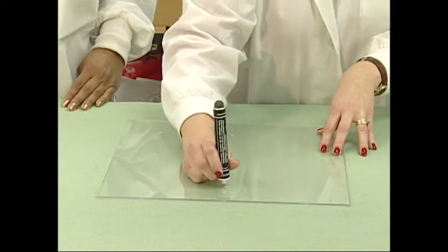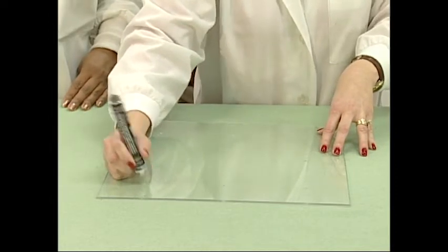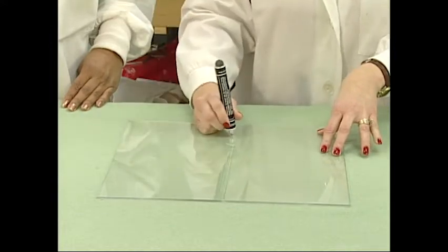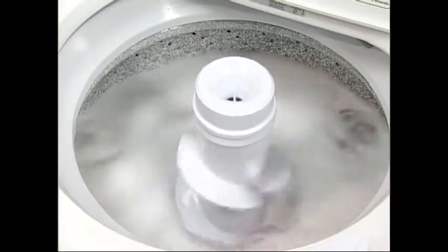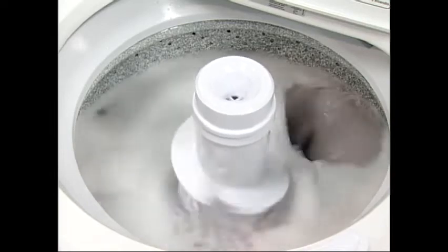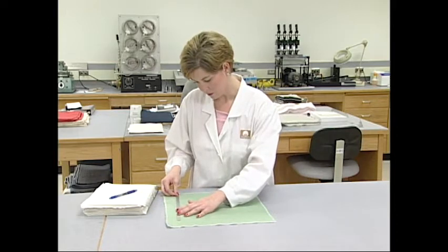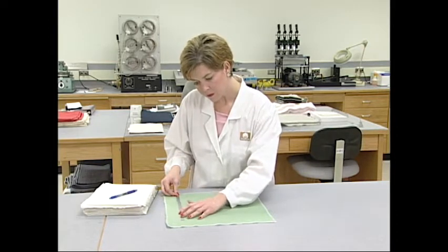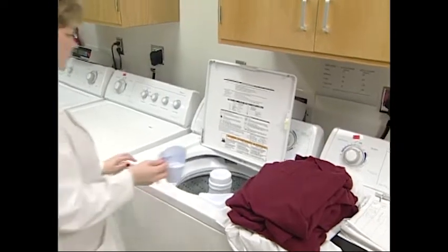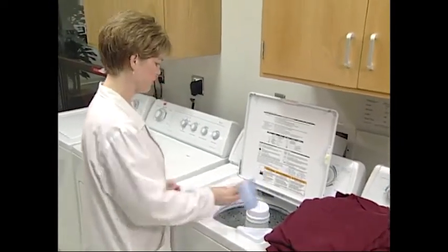Any method for measuring the dimensional stability of fabrics and garments must have four basic steps. These include a preparation step where the specimens are properly prepared, a testing sequence which washes the products with agitation under controlled conditions followed by drying, an evaluation process for measuring the dimensional change, and a data recording process.